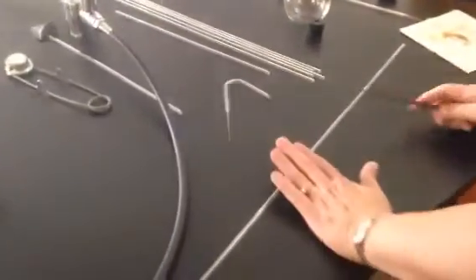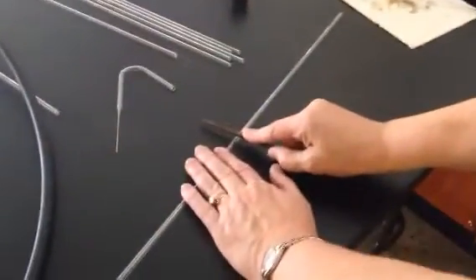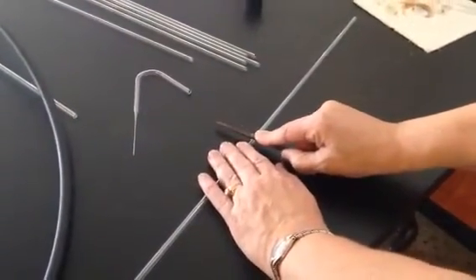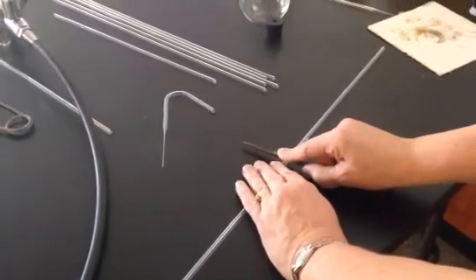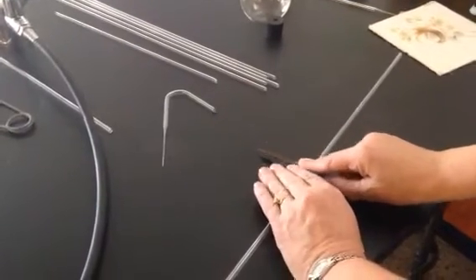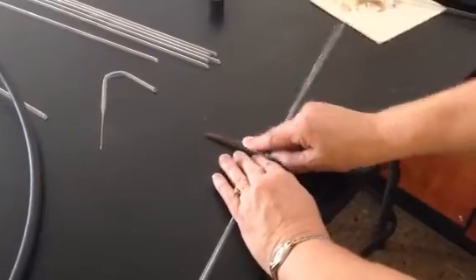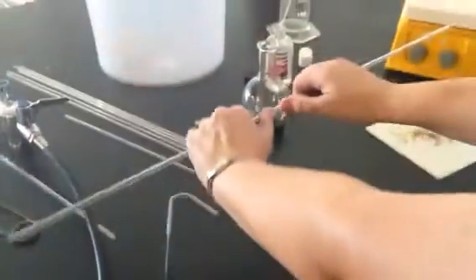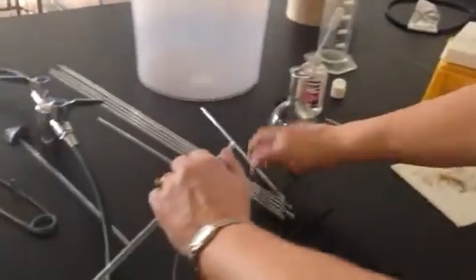Okay? So how we do that is we get these straight pieces of glass and we need to score them. So we take the corner or edge of a file and we really scrape the glass and roll it. It's got to make quite a bit of noise, so you have to push with a lot of force. Once you've scored the glass, and that might be going around twice, trying to get to the same spot, put your thumb on each side, push with a little bit of force, and it's in two pieces.